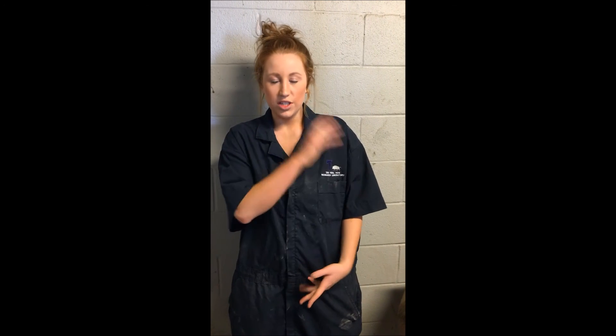The last area is the anterior vena cava. This is usually used on piglets, but it can be used on sows — it is just a little harder. The legs will be pinned backwards and the chin will be pinned downwards, and it is between the first rib and the breast bone. You would do it just like the jugular groove, only the pig is upside down. The needle sizes will vary by weight for the anterior vena cava method: between 10 and 45 kilograms, use a 20 gauge needle; between 45 and 100 kilograms, use an 18 gauge needle; and for sows, use a 16 gauge needle.